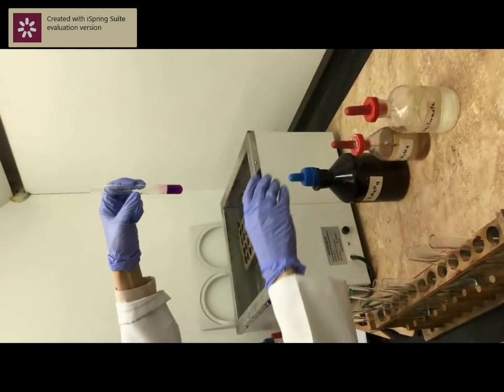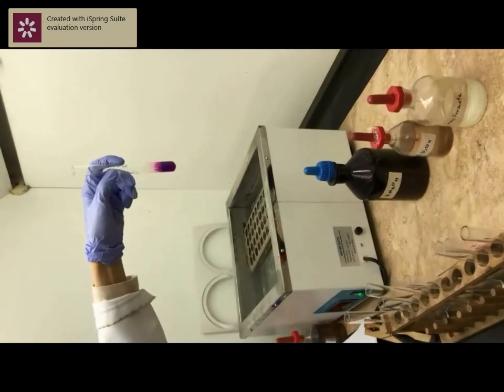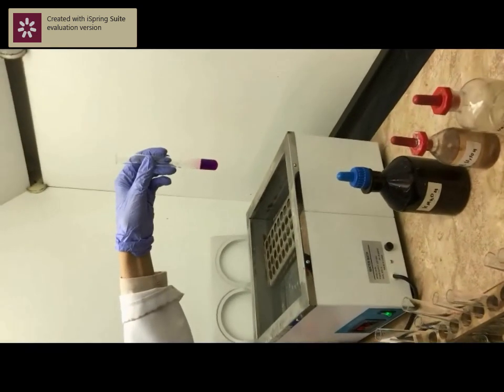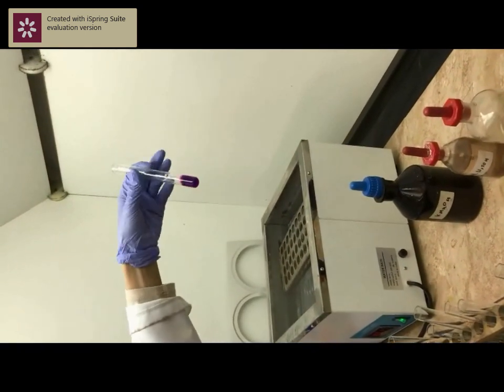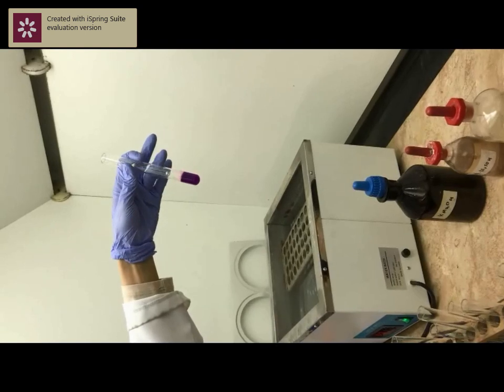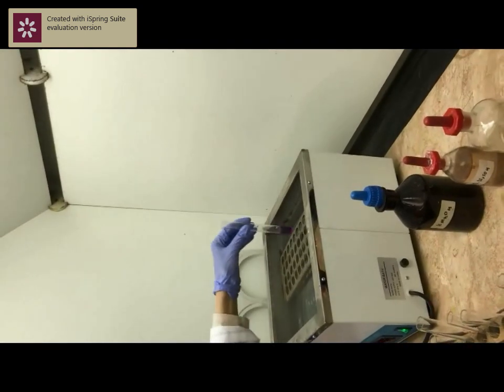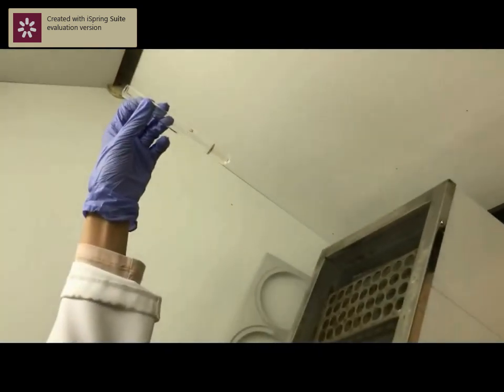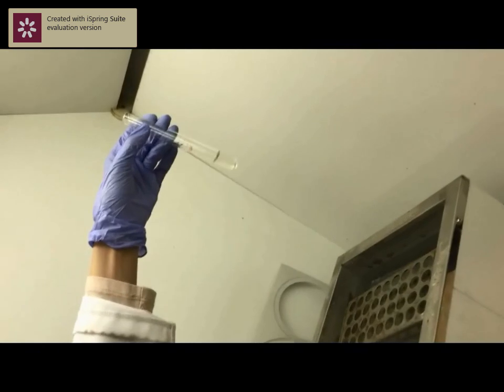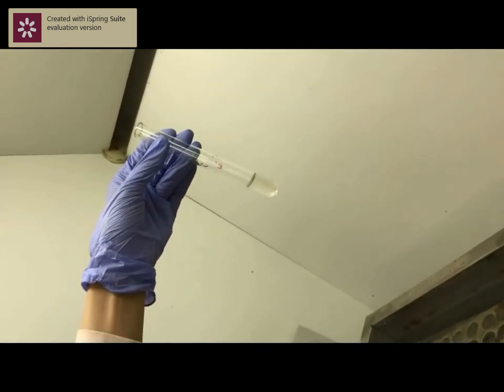Now we will warm the formate solution in a water bath until the color of permanganate disappears. After 10 minutes, you can see that the color of permanganate has totally disappeared.